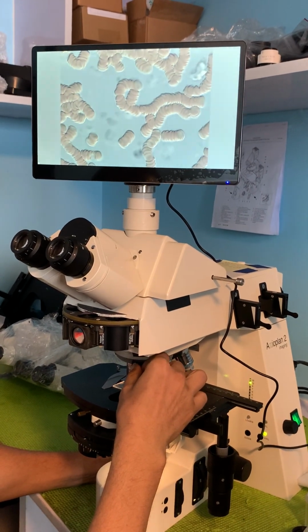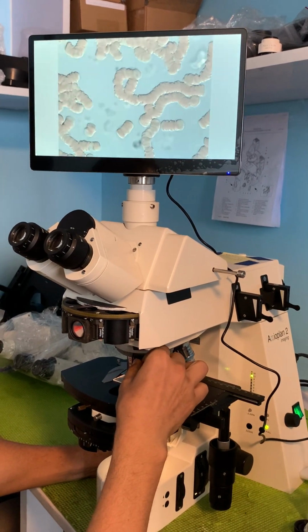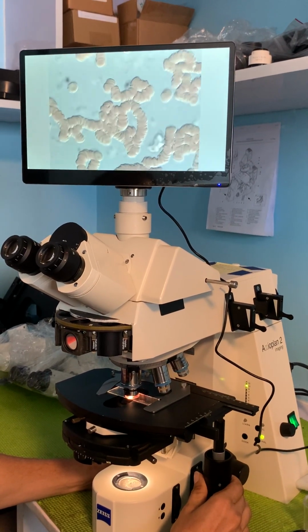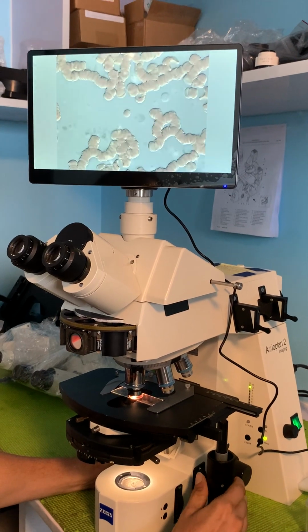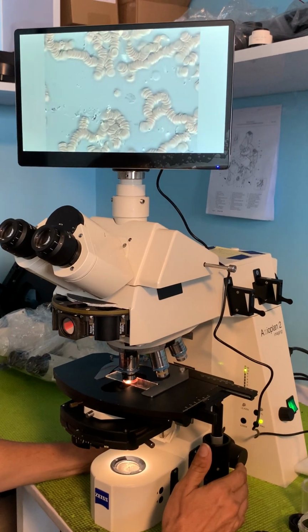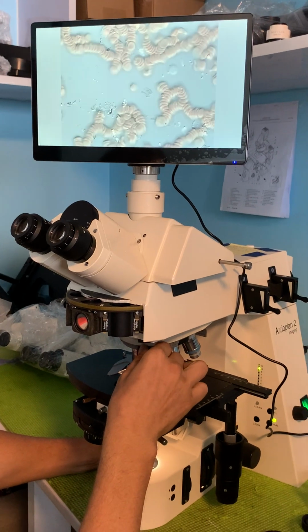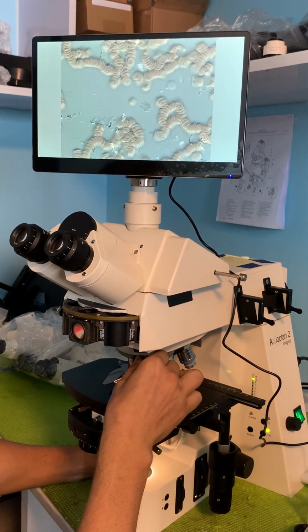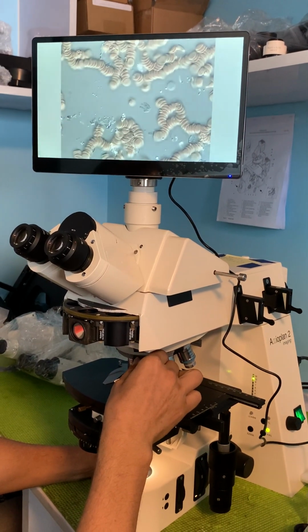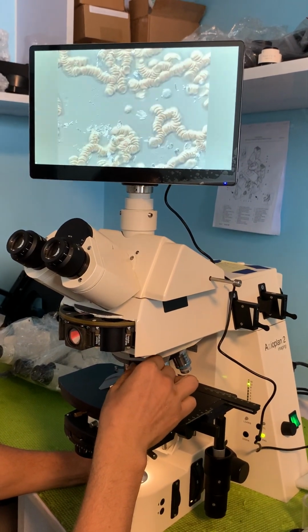And I'm also focusing it at the same time with a fine focus, and it just gives me different contrast and a little different image. Let's move the slide around. Pretty sharp focus there. Well, it's sharp depending on which blood cell you're looking at. There again, it's 63 power magnification. You don't have everything in focus at the same point because they're at different planes. So something's going to be out of focus.